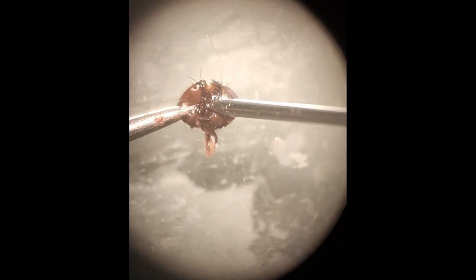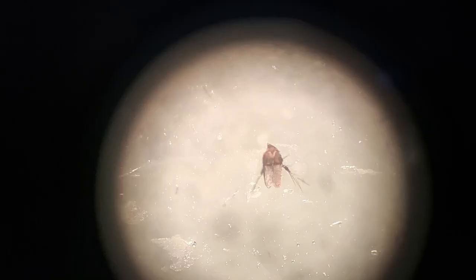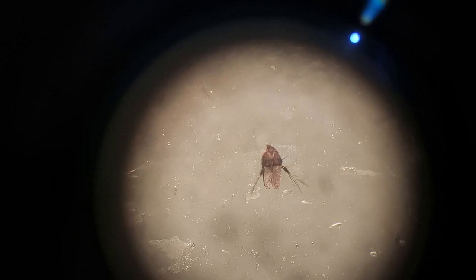And with the help of the right needle, which is very much sharp at its tip, as you are seeing, I am trying to cut the antennae at their base, at their proximal most portion. Now it is done.